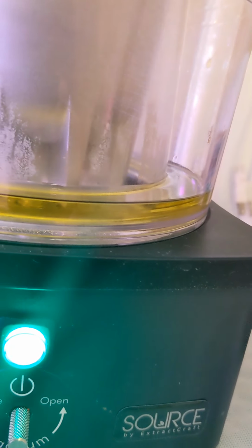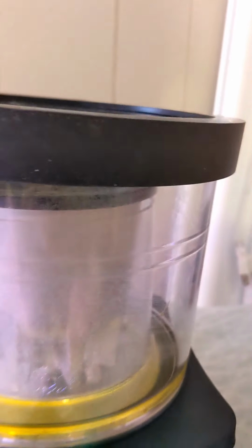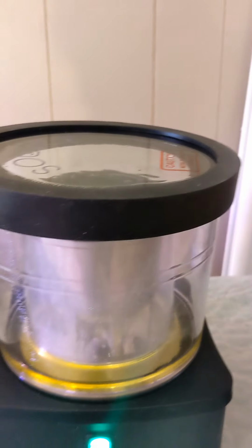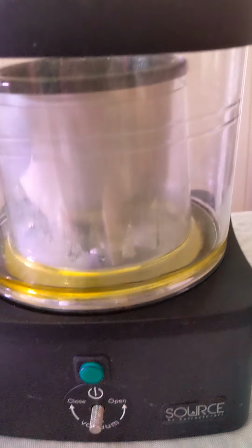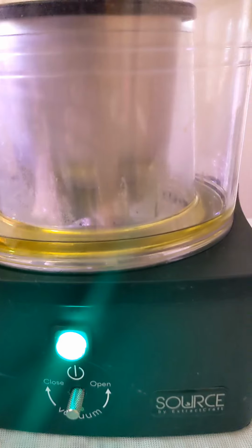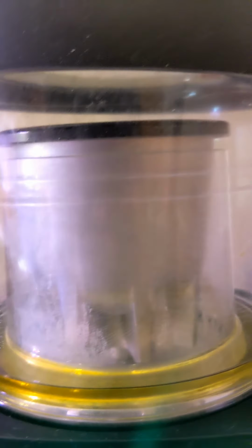So this has been running for about 10 minutes. You can see it started to work there. The lid has a built-in slope on it. It's only about maybe 7 or 8 millimeters, but it's on the inside. It's flat on the top here, but on the inside, one side is lower than the other. I believe it's this side on the right here. You can see dripping there. I think it's going to go here soon. Yeah, right there. You can see a drip forming, and boom. So that's all it does.